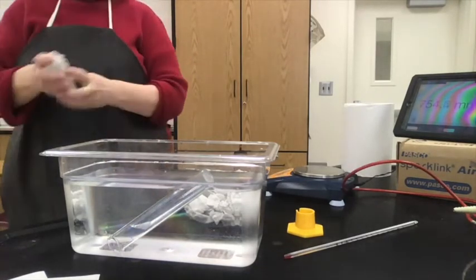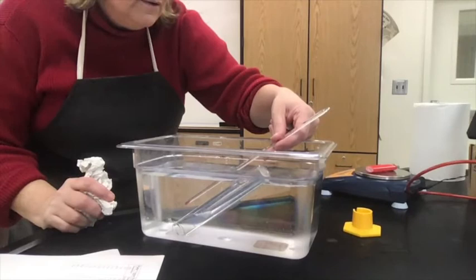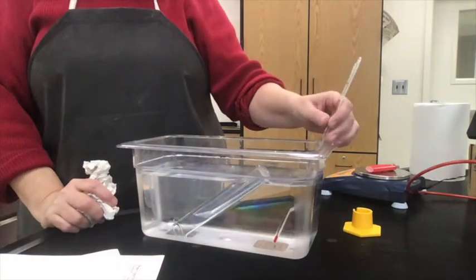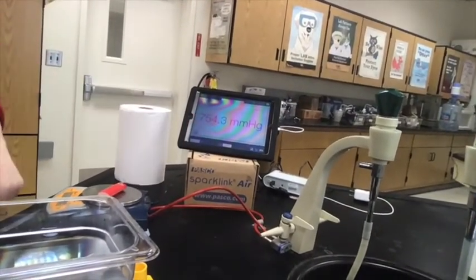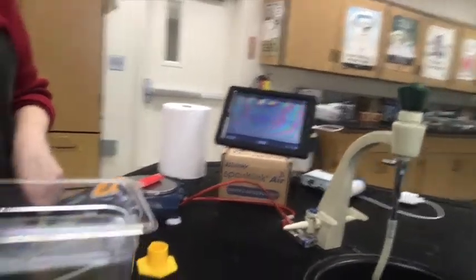Here's the final mass reading for the butane lighter for trial 3 — write it in the appropriate place. Getting our temperature — probably hasn't changed, still 21.0 degrees Celsius, so our partial pressure of water vapor is still 18.6 mmHg. Looking at the atmospheric pressure — it's going up a little bit, so you should actually have a different atmospheric pressure for trial 3. Record what you see on the barometer.